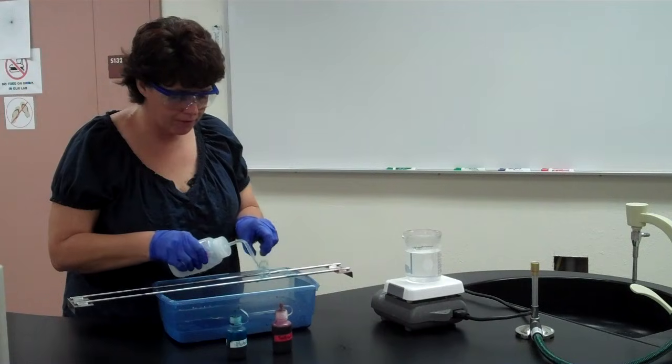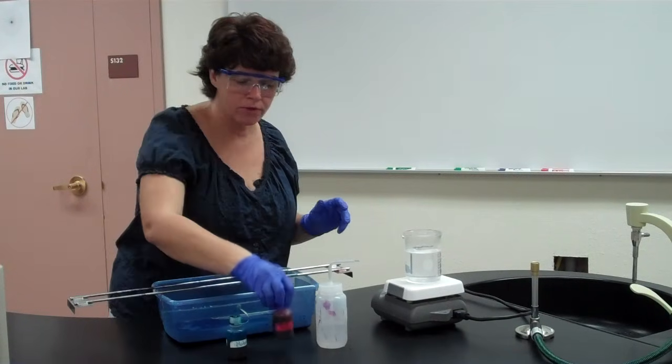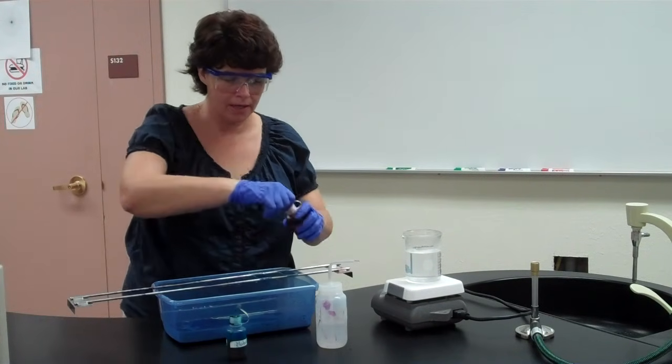So rinse them really good like we've got. Once again, don't be afraid to rinse, rinse, rinse. You can't really over rinse. We have no decolorizing step. We're going to go immediately to the counter stain, which is safranin. You saw safranin as the counter stain in the gram stain, okay?